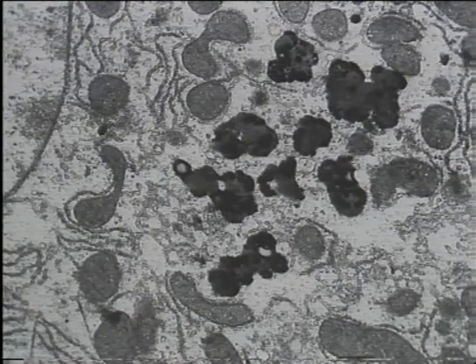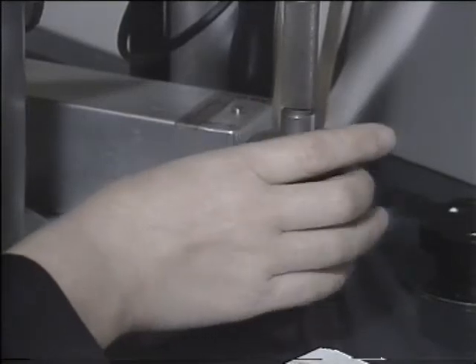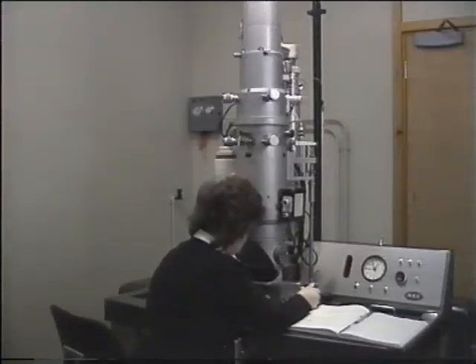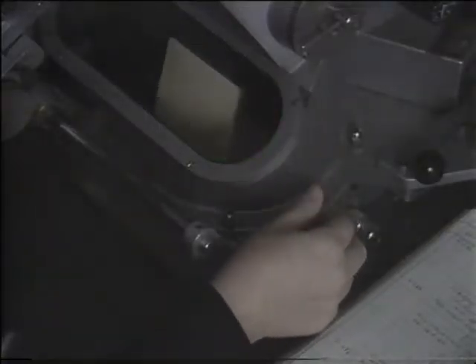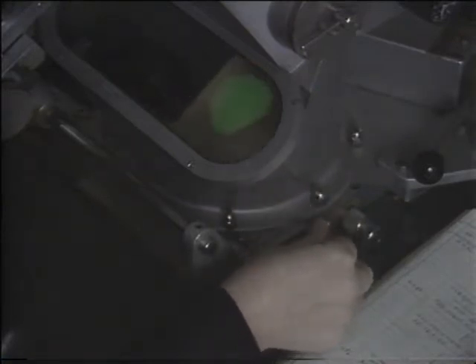Where the metal stains the specimen, the electron density in that area is increased, producing a much greater contrast in the final image. Using controls at the side of the microscope, the specimen can be moved around in the electron beam so that you can see different areas of it. And if you want to take a photograph of what you see, the fluorescent screen is moved out of the way and the electron beam focused onto a photographic plate or film, which is also sensitive to electrons.